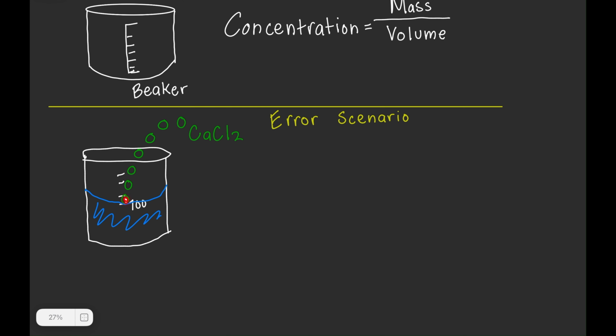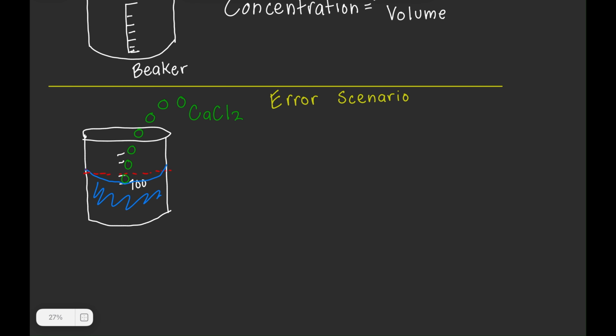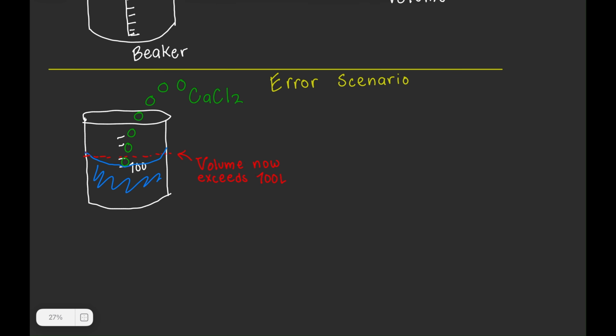because what happens is as you put your calcium chloride into your 100 liters of water, this water is going to be displaced, and we'll do a red line, and eventually this will come up a little bit. So now you have more of this solution, and so this is going to be incorrect. So by adding that salt to the full 100 liters, the final volume will exceed 100 liters. So we'll draw this red line here. So we'll say the volume now exceeds. Since the volume is now too high, the concentration of calcium chloride will be too low. And in a professional biotech setting, that would be a procedural failure.